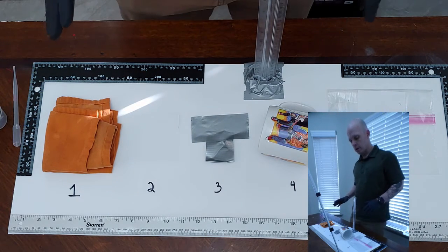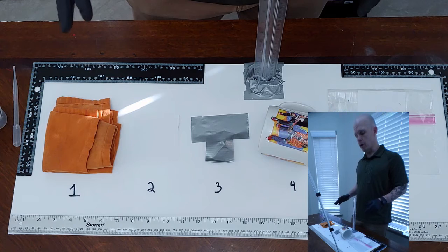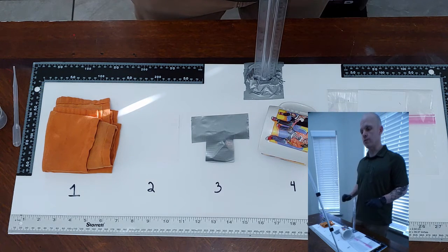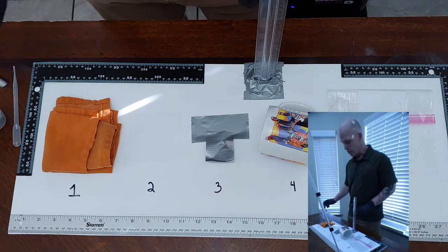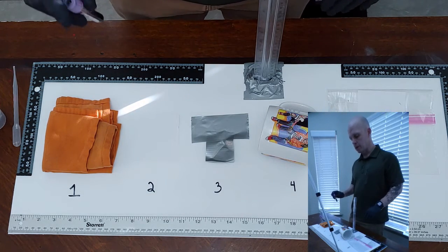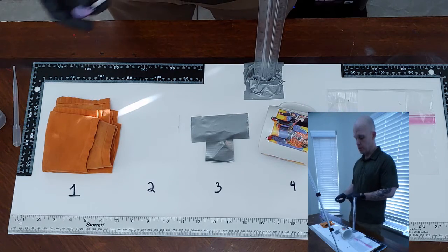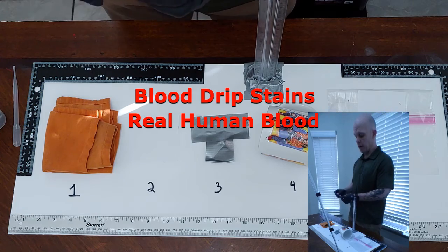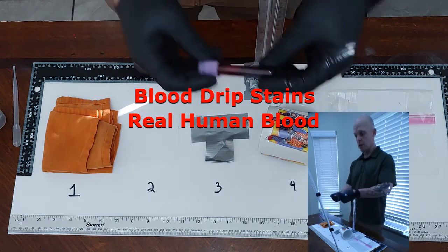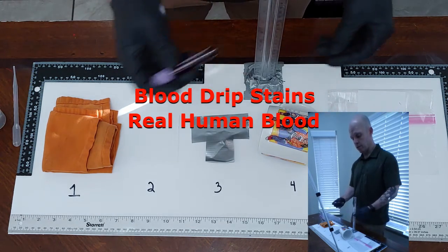And then just remember, what this is going to demonstrate is you have to be aware of what type of surface these drip stains are falling on. Depending on the material that they fall on, they're not going to look the same every time. So we're going to create blood drip stains with exactly the same mechanism, but they're falling on different surfaces. So in a previous video, please make sure you watch it, I drew my own blood, so I'm going to be using my own blood, real blood, for this experiment.